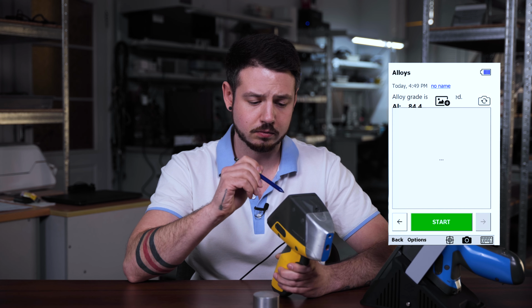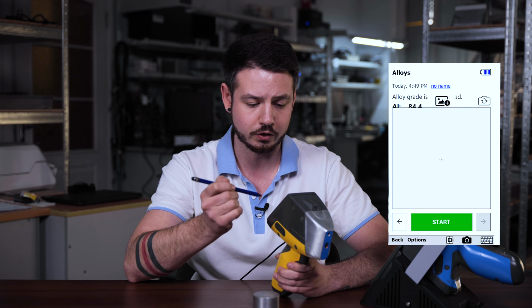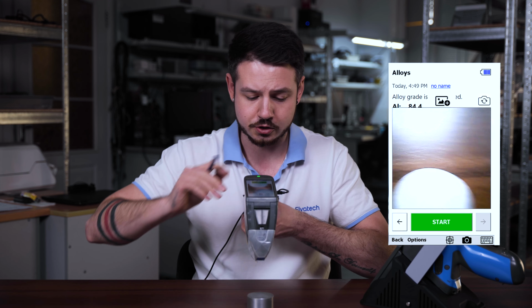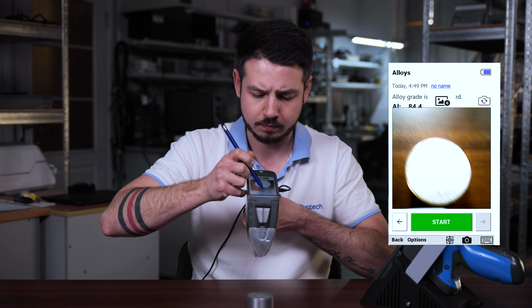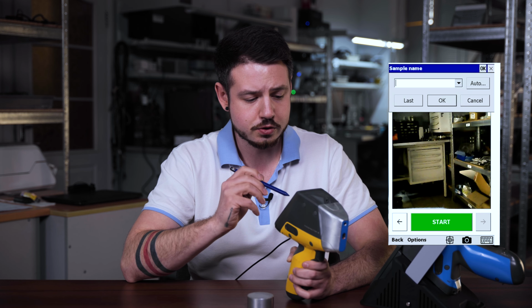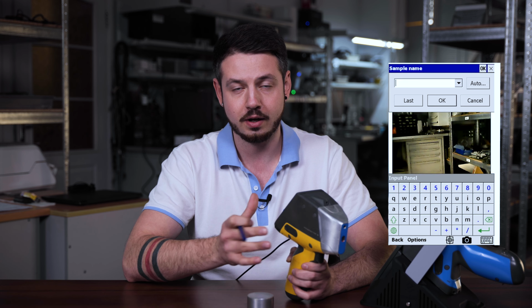Then we can use the reverse camera, because here we have the micro camera, and now we go to the micro, and we measured this sample. So right now let's take a picture of it. Just press this button. Great. And also you can name the sample, so you will have the result, the photo and the name of it. Pretty easy. This is especially useful when working with a large number of samples, allowing you to keep the visual history of each analysis for future comparison or reporting.